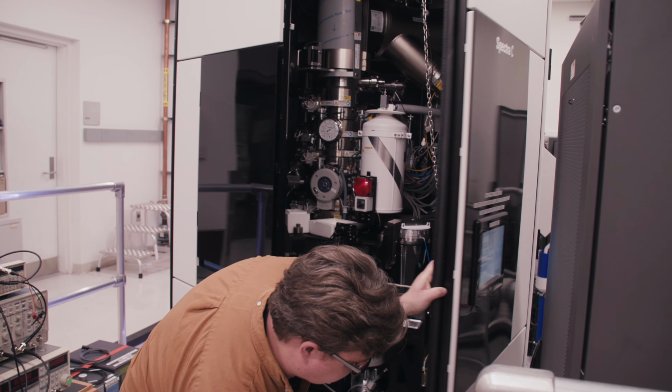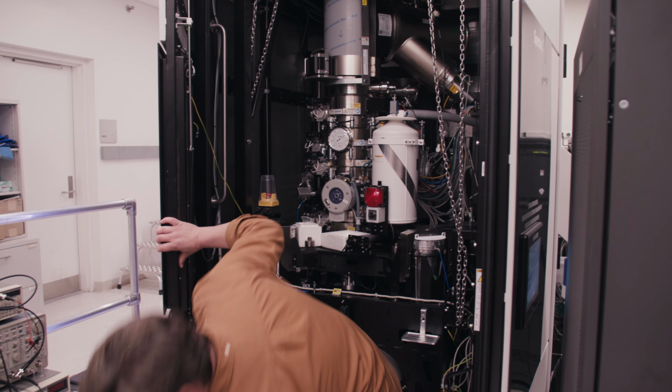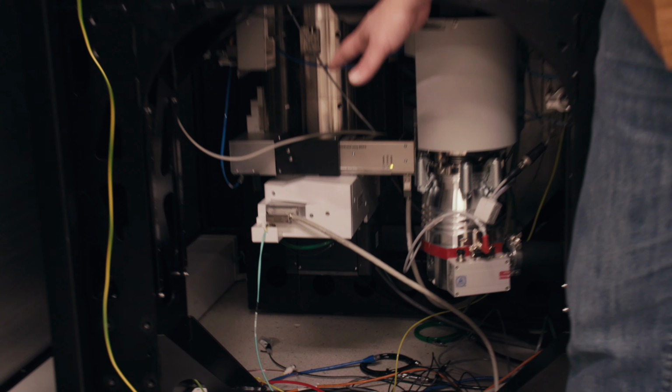We can talk about an electron microscope in 3 parts: source, optics, and detectors. The source forces electrons to quantum mechanically tunnel through a potential barrier. These electrons are then accelerated through 300,000 volts to about 3/4 the speed of light. The now relativistic electrons travel through a series of 2 Tesla magnetic fields that act as convex lenses. The electrons interact with the sample and produce an image that is magnified by nearly 1,000,000 times before it is captured on an electron detector placed about 3 meters below the electron source.